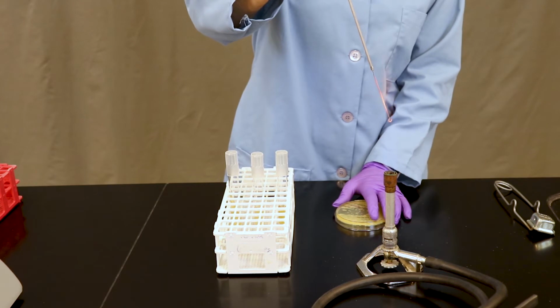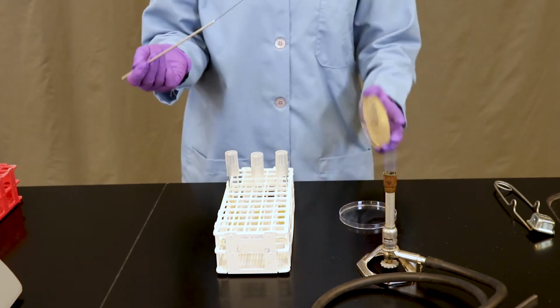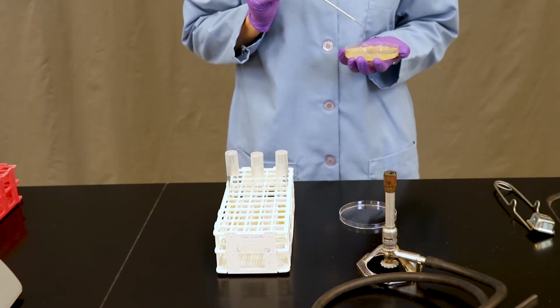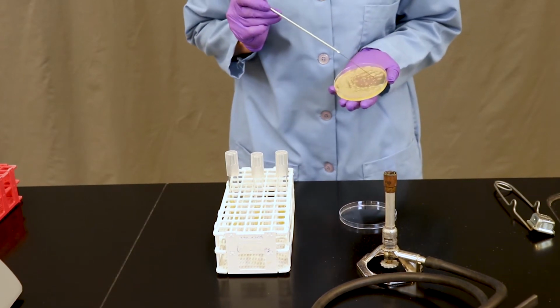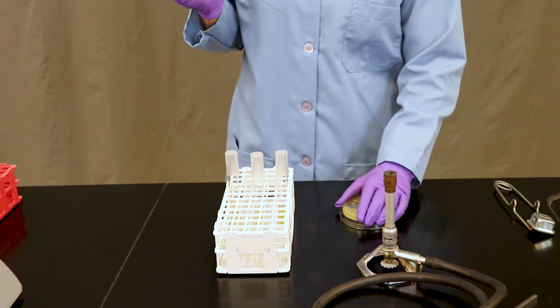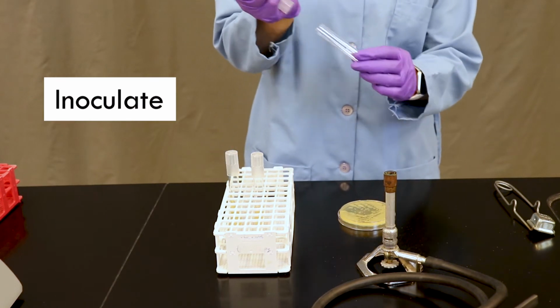Before we can show you how to inoculate, we want to make sure that our metal loop is first sterile by passing it through the flame until it turns orange. We're going to cool it on the side of the agar. You may hear a sizzle. And we're going to pick up a single colony from our Petri plate of interest, and transfer it, or inoculate it, into the first type of media.